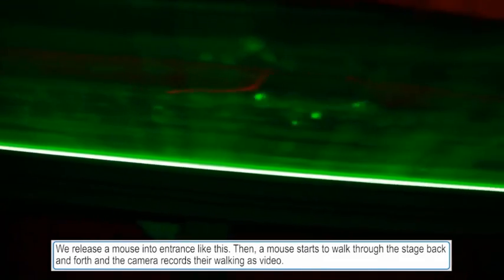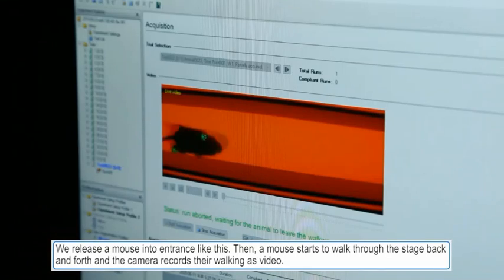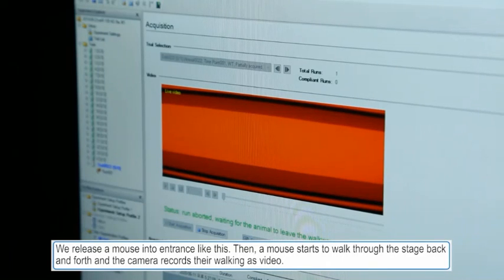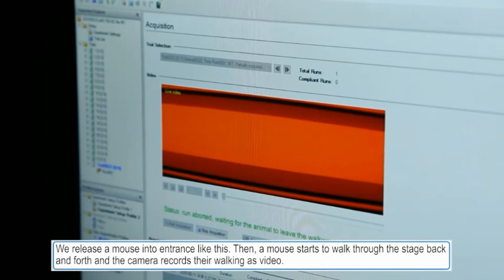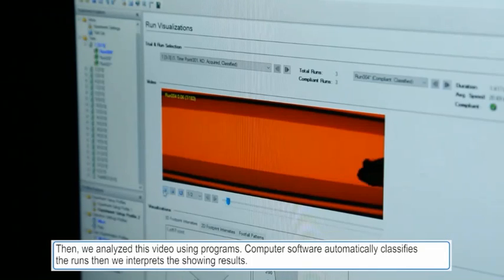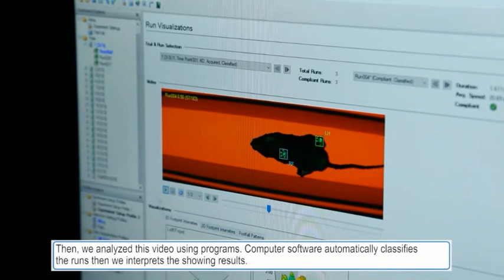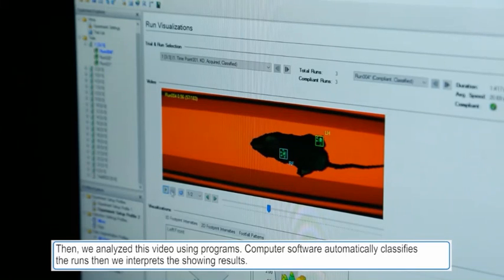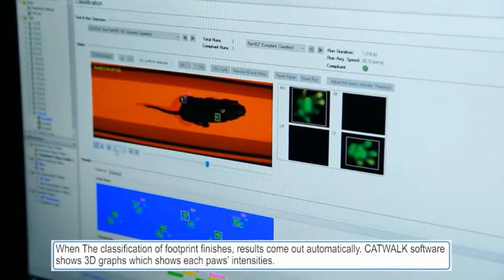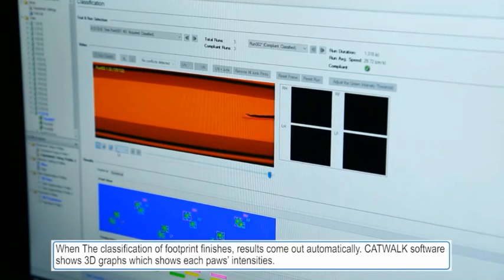We release a mouse into the entrance like this. Then the mouse starts to walk through the stage back and forth. The camera records their walking as video. We then analyze this video using software, which automatically classifies the runs. When the classification of footprints finishes, results come out automatically.